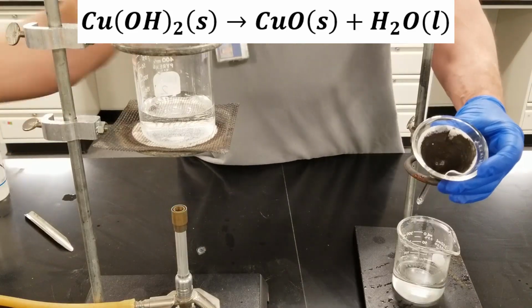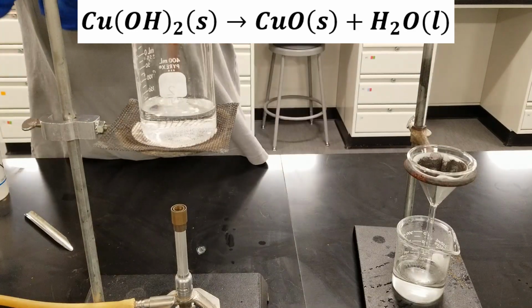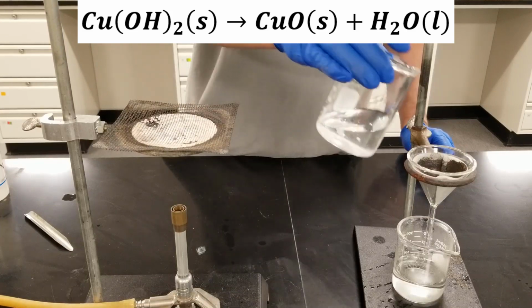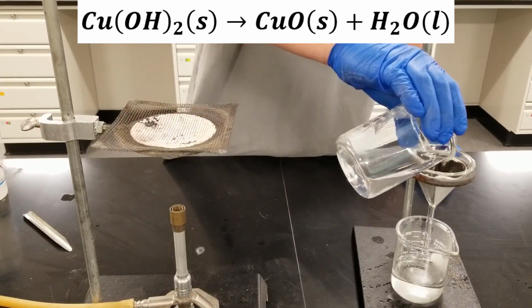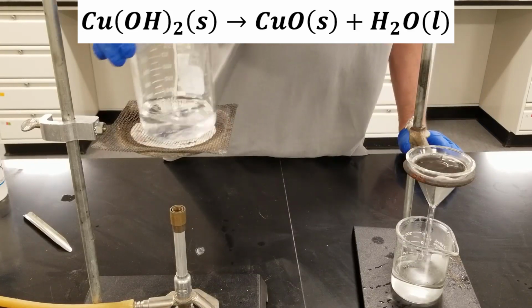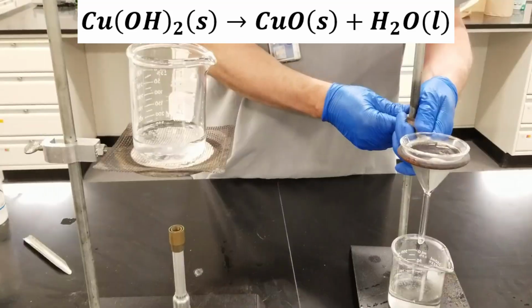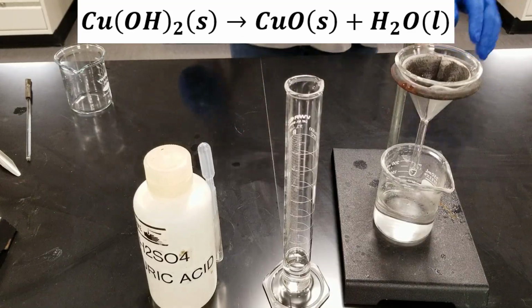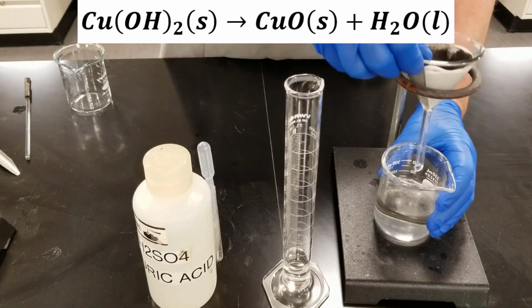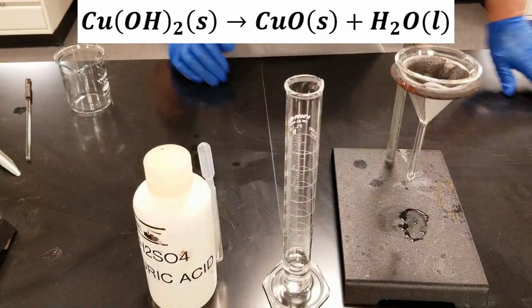So we'll take some hot water here and use that to rinse the copper oxide. And that should get rid of all those excess nitrate ions. Okay, so here's our copper oxide, which we've just washed with hot water. We want to get rid of that wastewater. That's got those nitrate ions we're trying to get rid of.